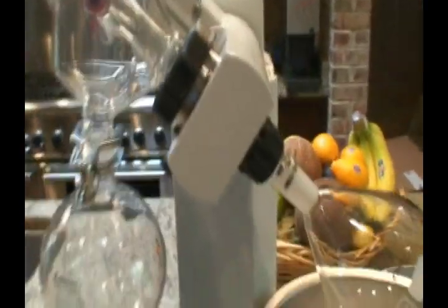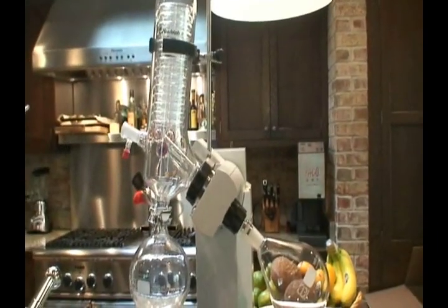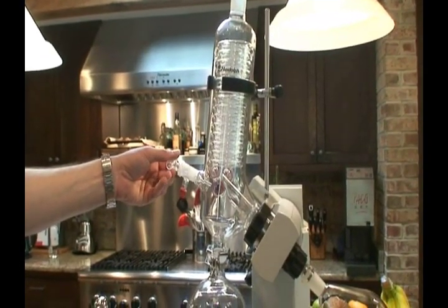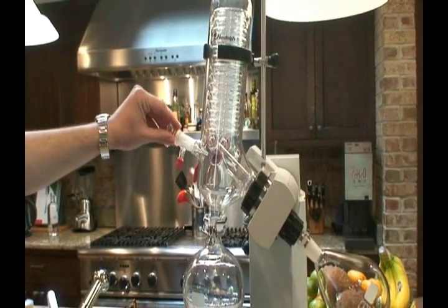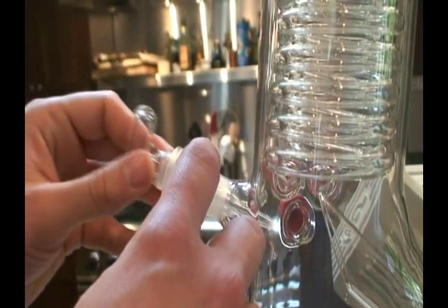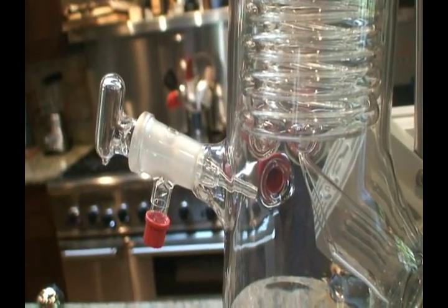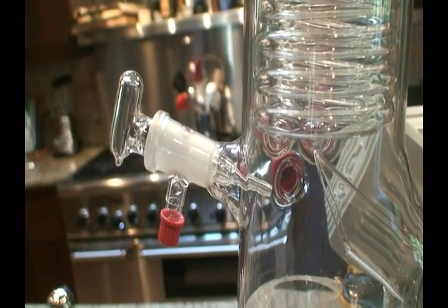We're going to be hooking up a very simple vacuum system — an aspirator-type vacuum. That little device is the vacuum regulator, a stopcock manual regulator operated by hand. These two little holes, one here and one on the outside of the condenser, open to the environment, and as they are closed, full vacuum is reached inside the unit. As you bleed in more air, the vacuum level raises.